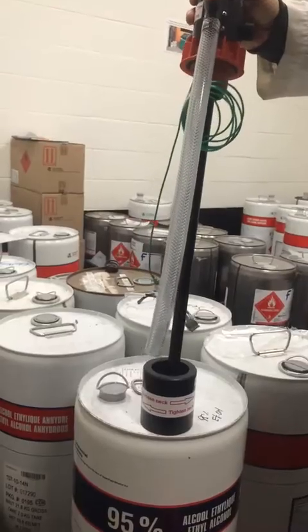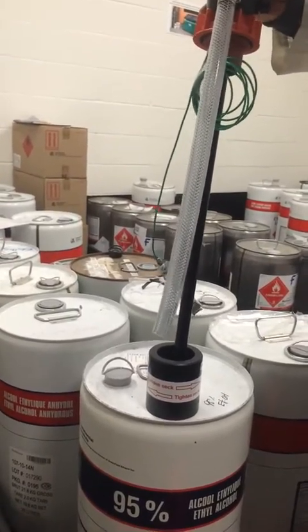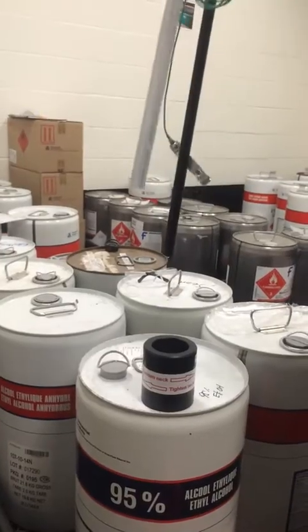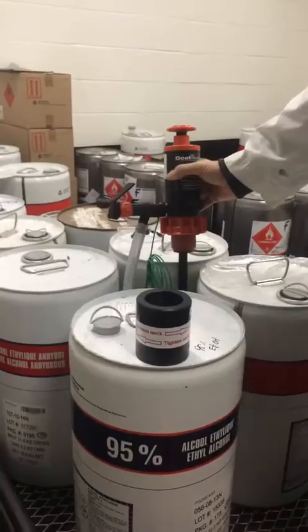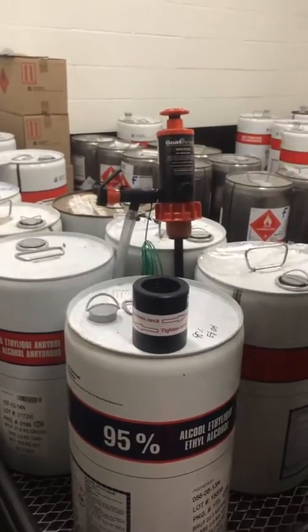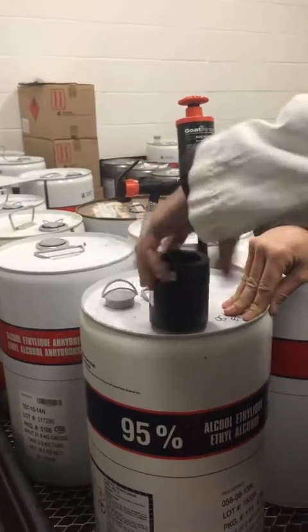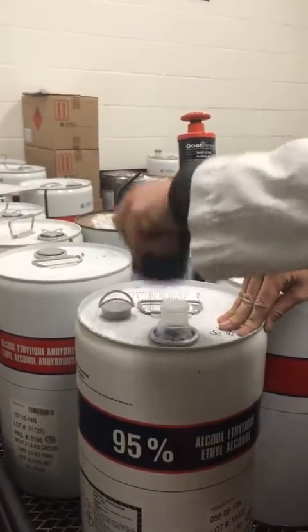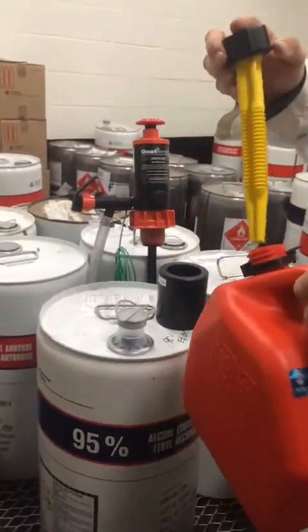There's quite a bit of fluid so let it flow back into the drum. A few little drips — not too bad. Then place the pump on the catcher tray for a few moments to catch any drips. Remove the neck adapter, seal your drum, and seal your secondary container.